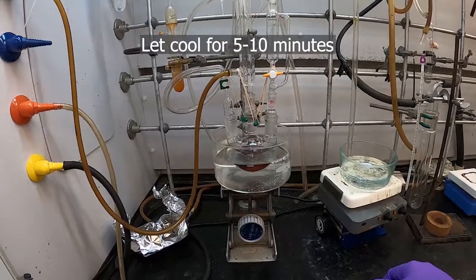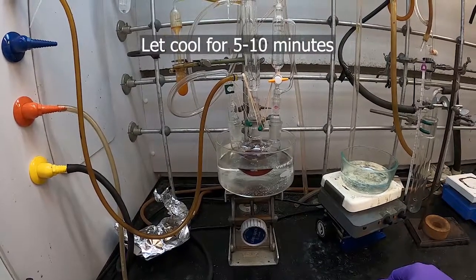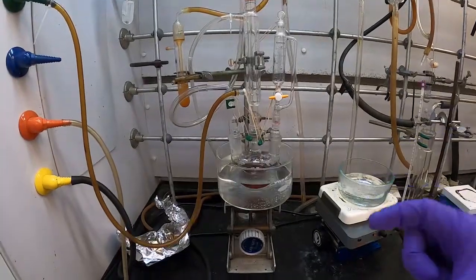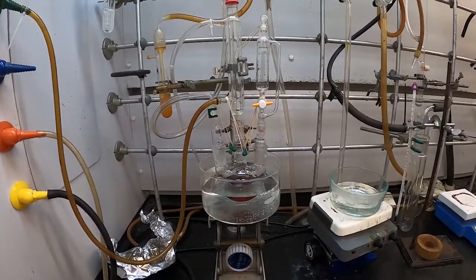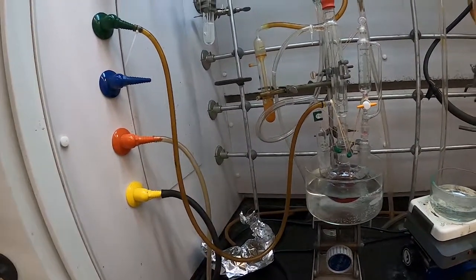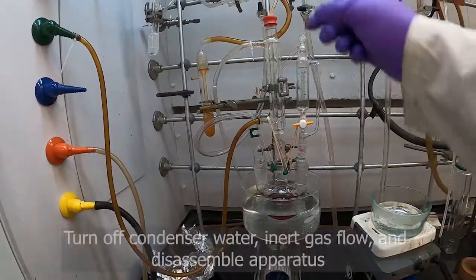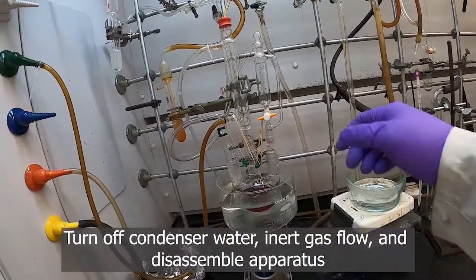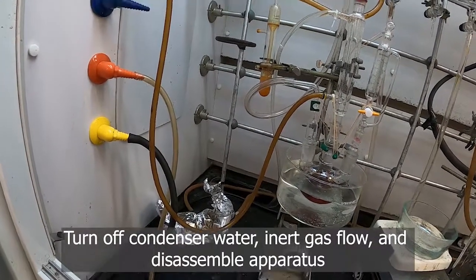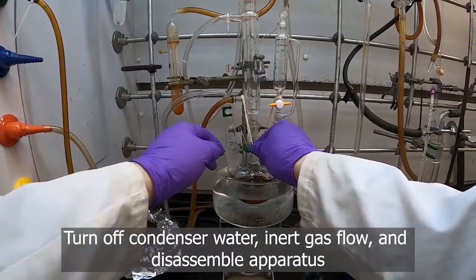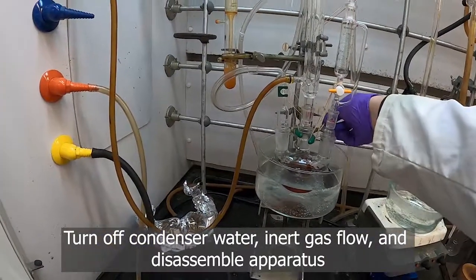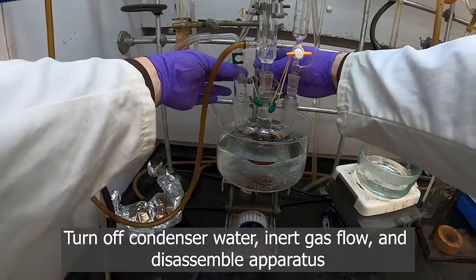So our flask has now suitably cooled down. We can turn off our condenser water as well as stop our nitrogen flow. We can pretty much just disassemble our apparatus at this point.